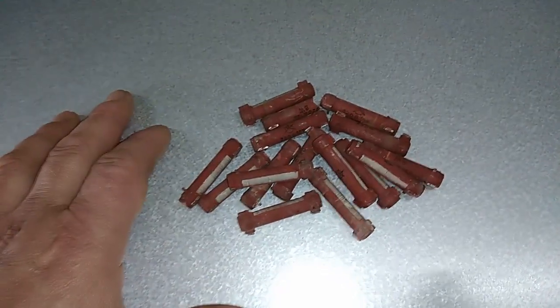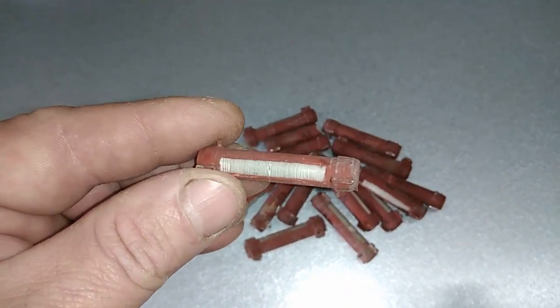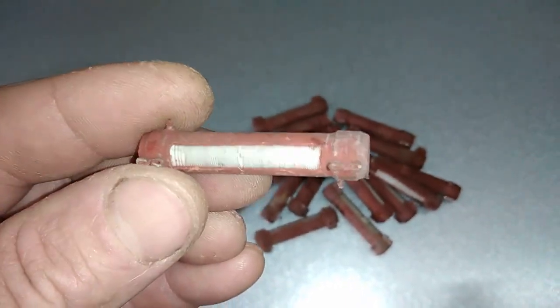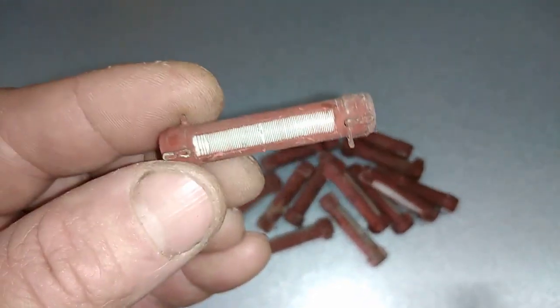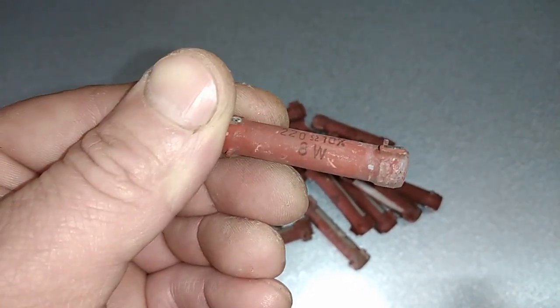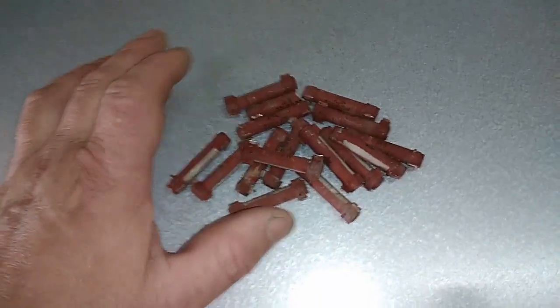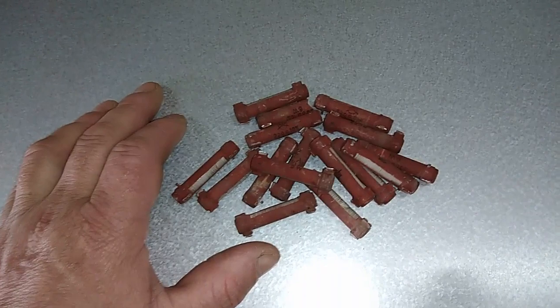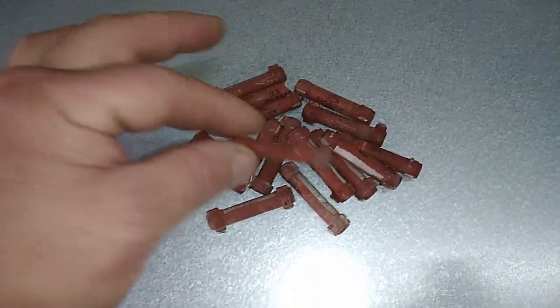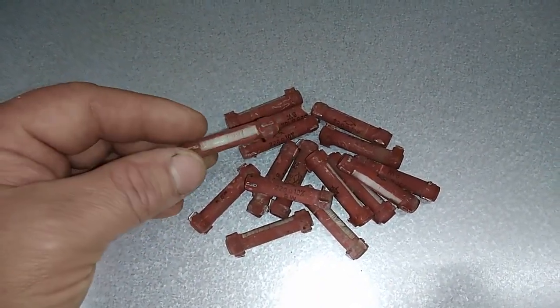If you don't trust me, you can find that information on the internet. In this case I have a couple of these with the wire made of a silver and nickel alloy. I'm gonna crack them into small pieces and wash that with nitric acid. I won't put it on heat because the base metal is here and the solution will get hot by itself during the dissolution step, and in the end I'm gonna drop some silver.